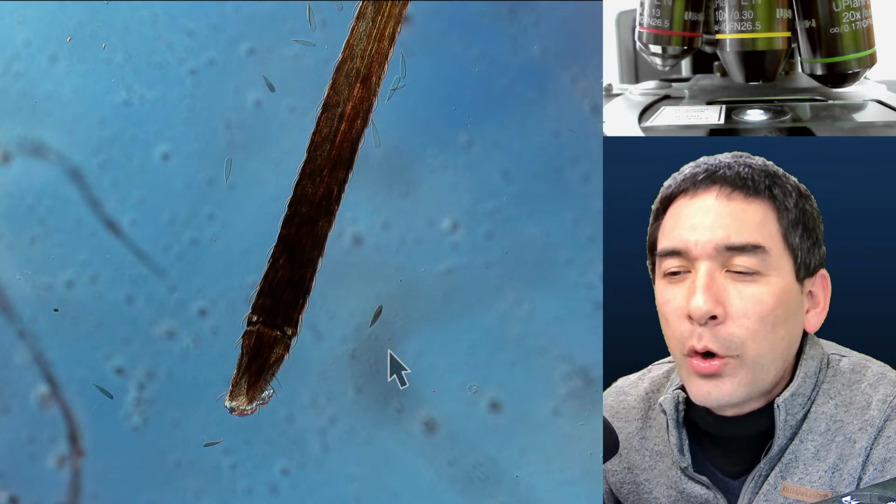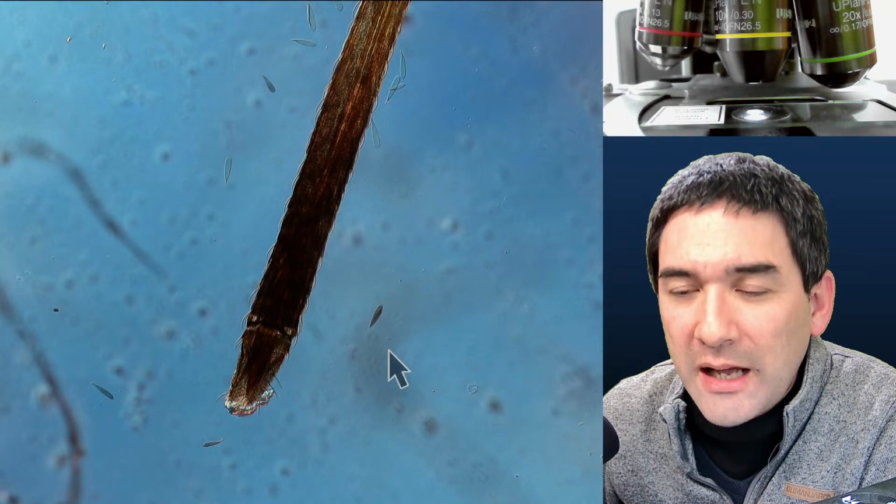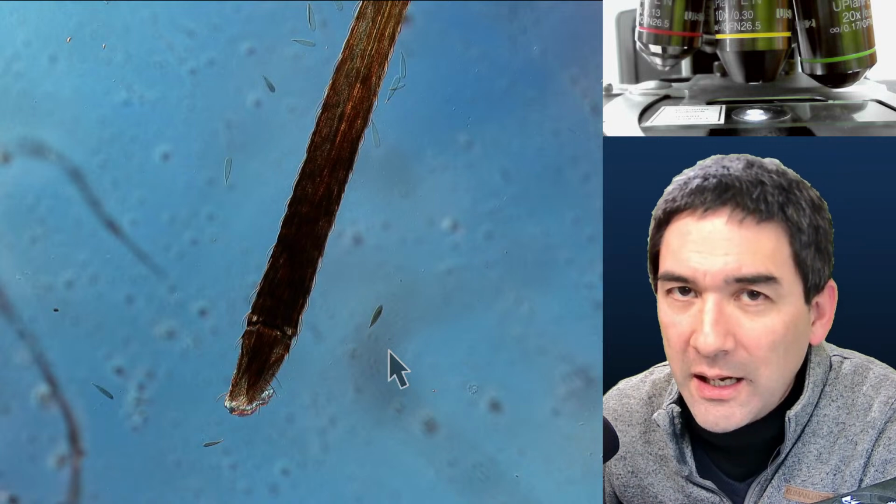By the way, where are the compound eyes on the tick right now? Well, ticks are not insects, so they do not have compound eyes. Okay, so they should actually have lens eyes.